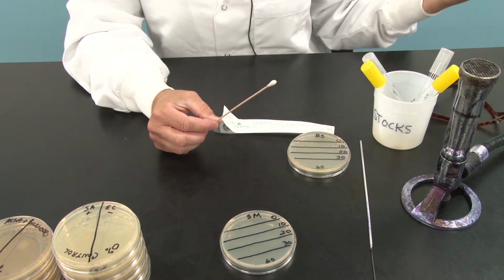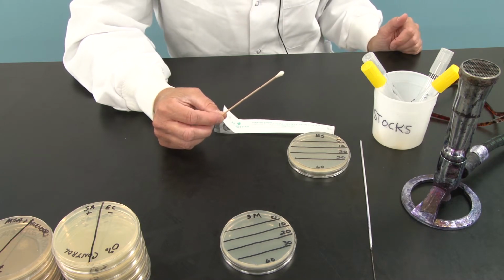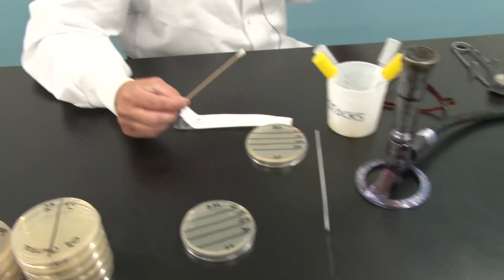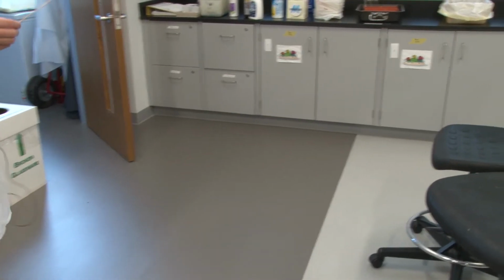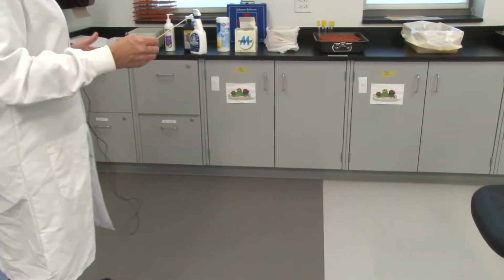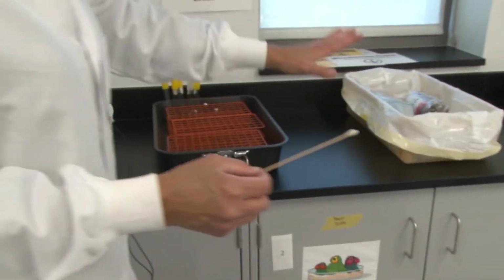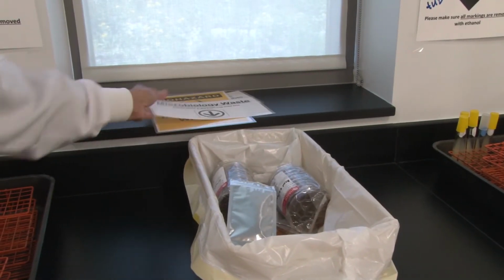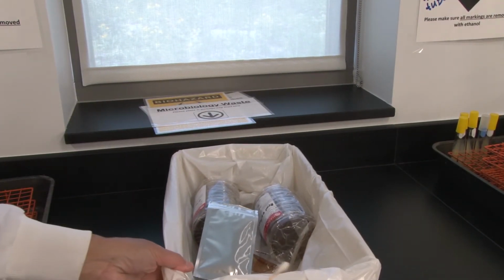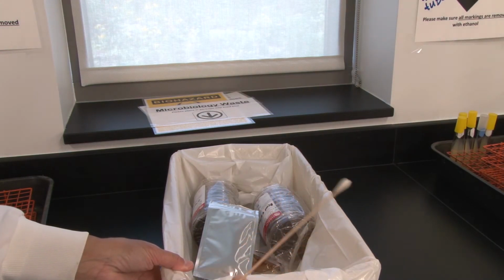Let's walk over to the disposal at the side of the room, because I want you guys to see where our microbiological waste is located. I know I've shown you the placement of contaminated tubes for broth and agar, but right here where it says microbiology waste, this tub is where we put our plastic petri dishes when we're done with those cultures, and where we put things that are not made of glass, such as this swab.